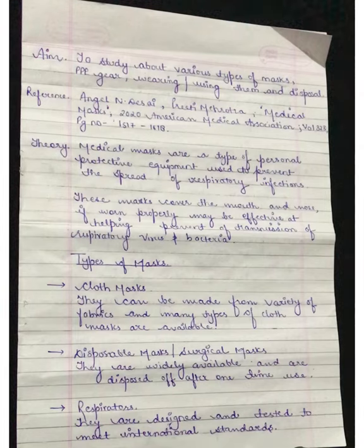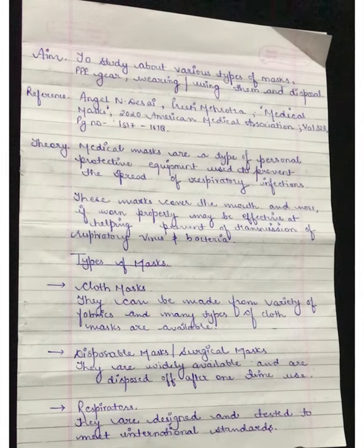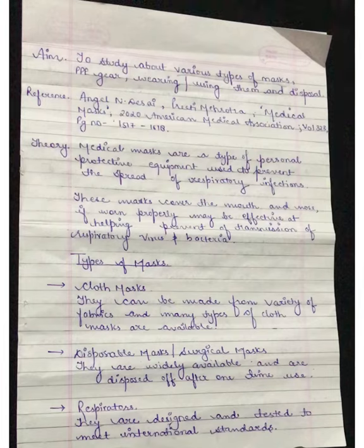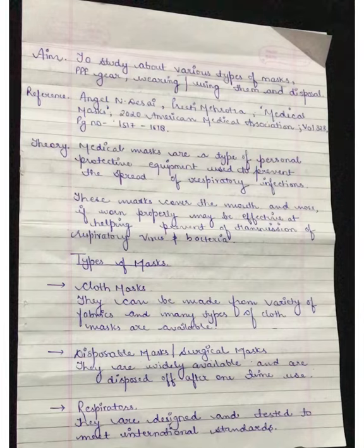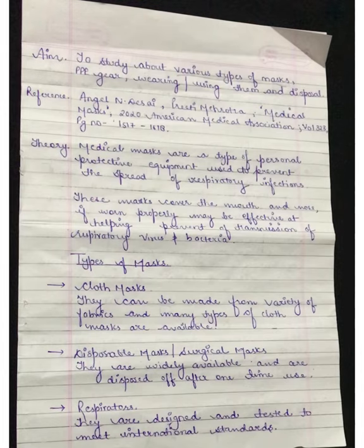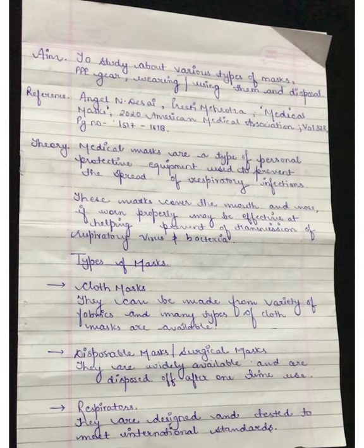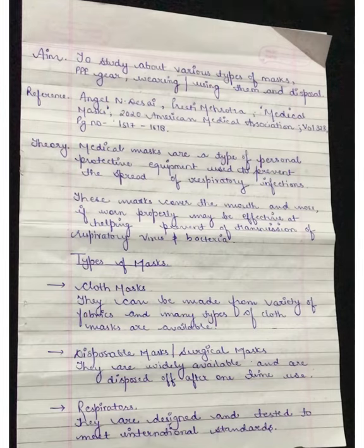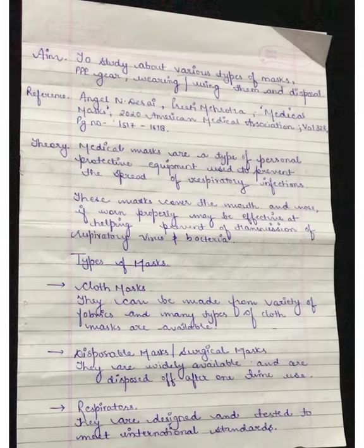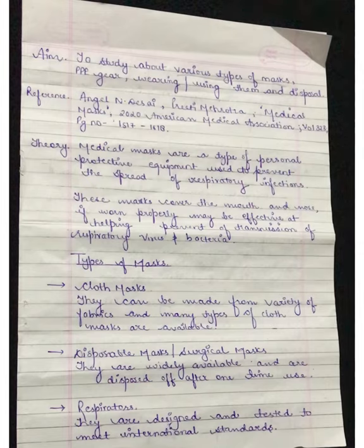There are different types of masks. First is the cloth mask, which is made of any kind of fabric. They can be made from a variety of fabrics and many types of cloth masks are available. Next are the disposable masks, also known as surgical masks — the blue or green color masks that we commonly see. They are widely available, comparatively cheap, and are disposed of after one time use.